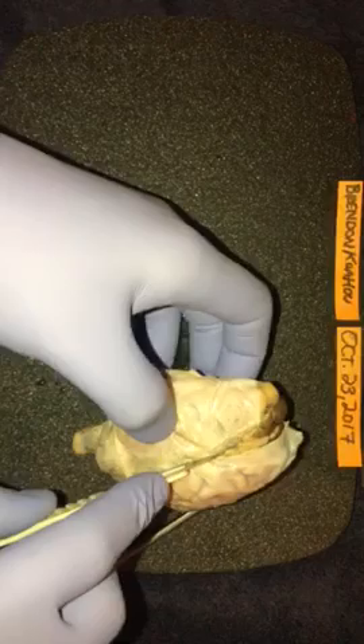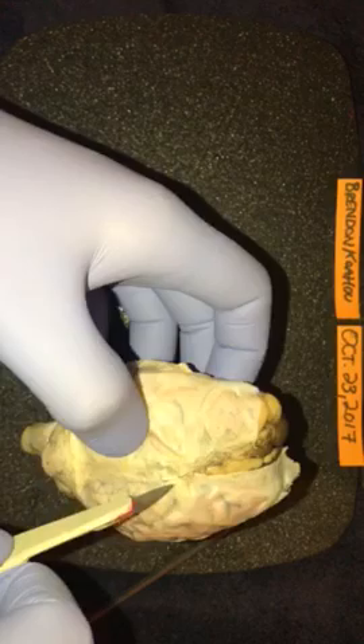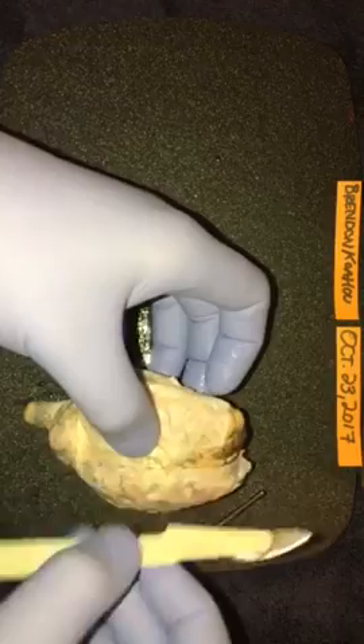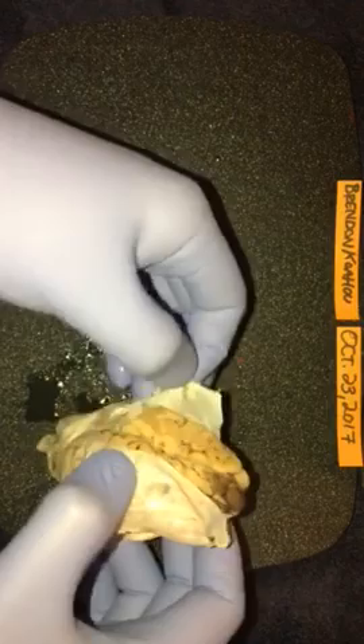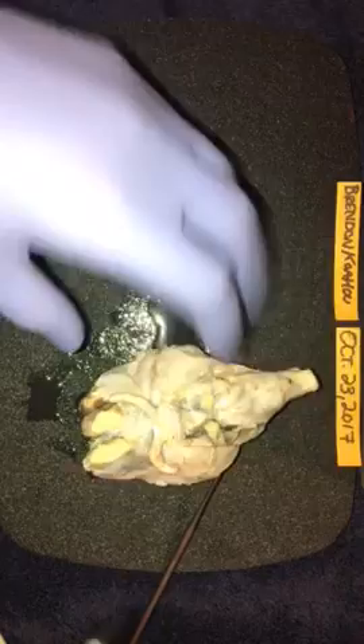Just cut away a lot of this. As always, you want to be very, very careful not to actually cut the brain — you just want to cut away this top layer of protective film here. It cuts pretty easily. I'm sorry, I don't remember what it's called — maybe you can help me out with that. This is actually the old scalpel I'm using, I apologize for that. So let's open it up — this should, once you make your incision, peel away pretty easily. Let me do some more cutting here. I love how beautifully a scalpel cuts.